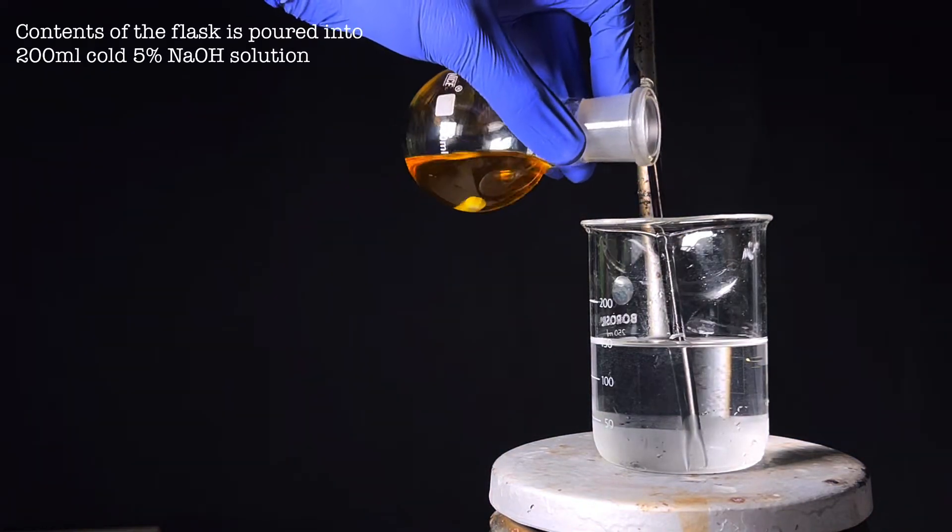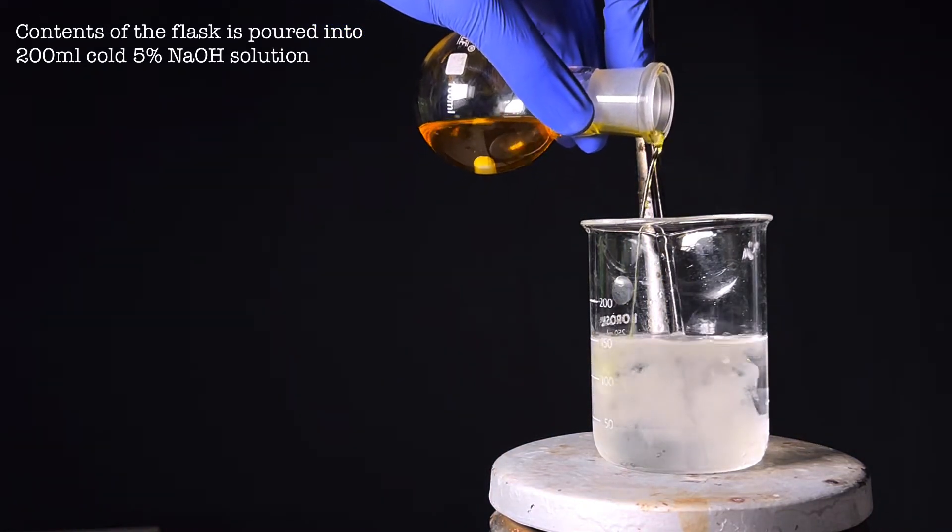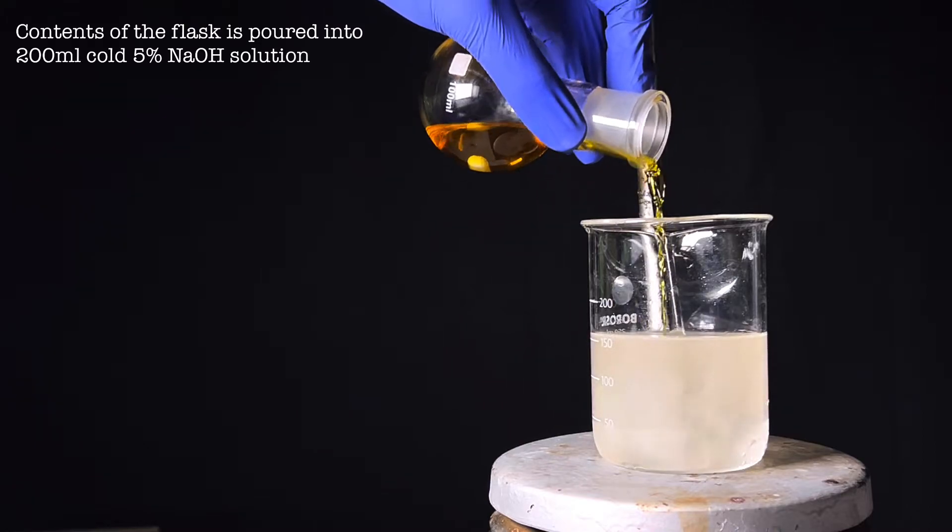After that, the contents of the flask were poured into 200 milliliters of cold 5 percent sodium hydroxide solution.